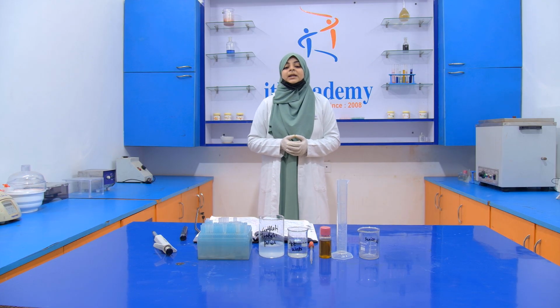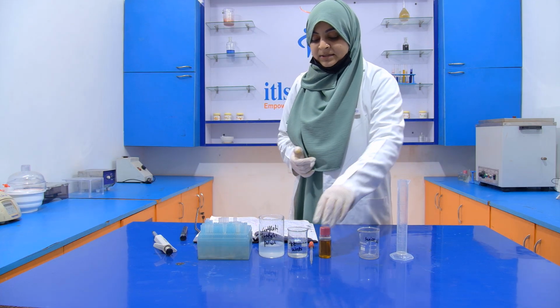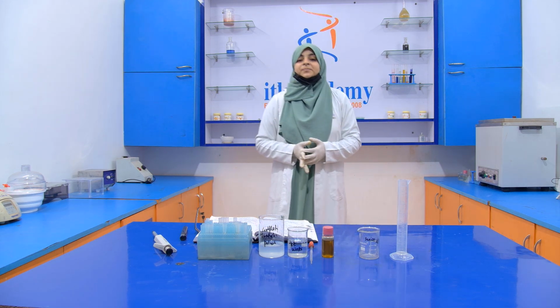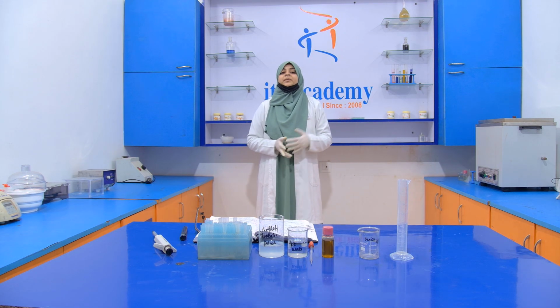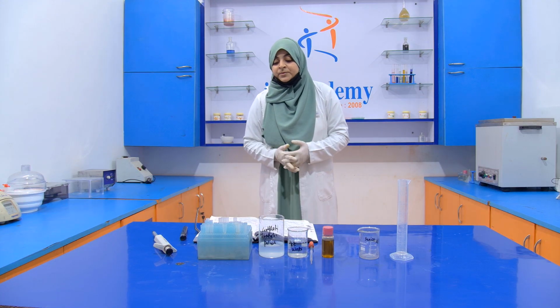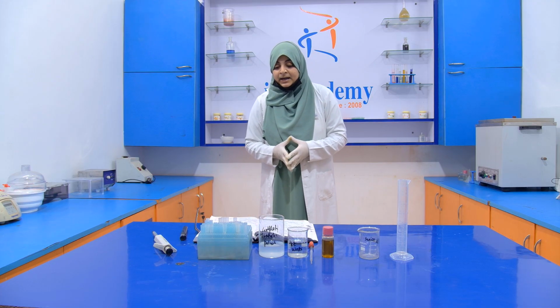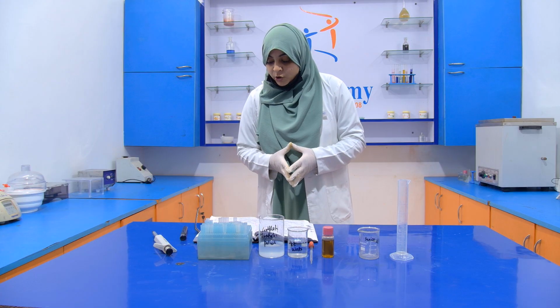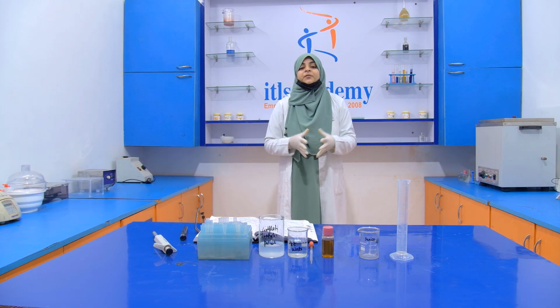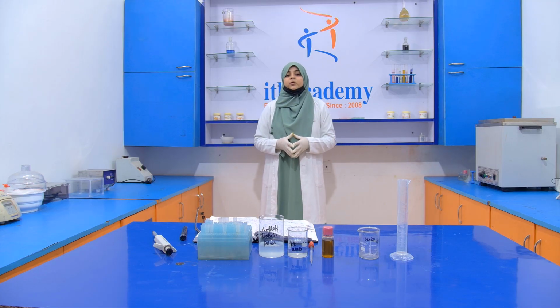Here the mineral oil acts as an adulterant, and the sample is our edible oil. This is our sample. Now, why is this mineral oil added into the edible oil? Because it releases an agent which prevents the food items from sticking, and also creates a glossy environment.